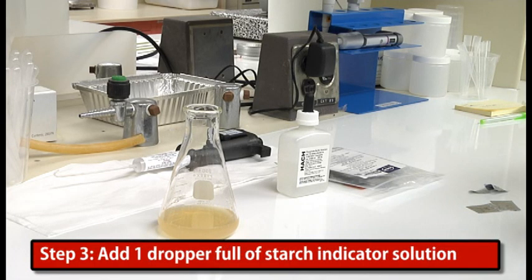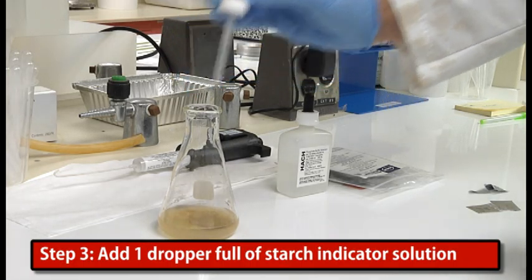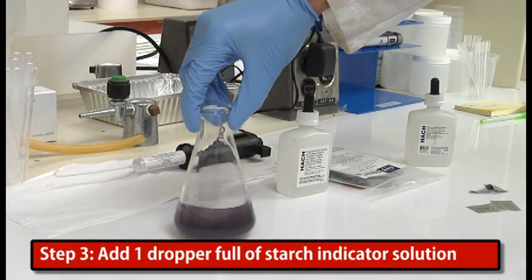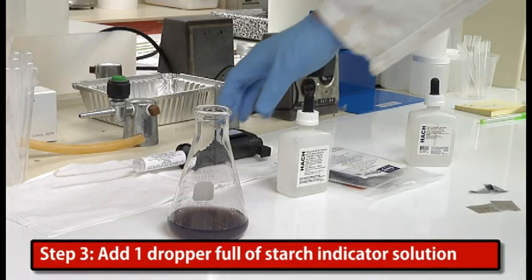Then I'm going to add 1 dropper full of our starch indicator solution. The starch indicator solution reacts with the oxidized iodide and forms a purple complex. And the color change is proof that we have a residual level of chlorine dioxide in the sample. Now that we've determined there is residual chlorine dioxide, it's important to measure that residual to see if it's within the parameters that we desire.